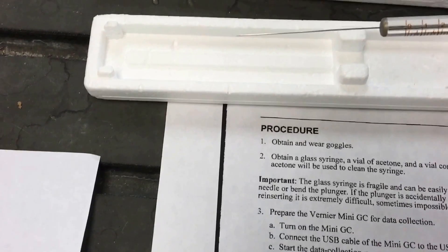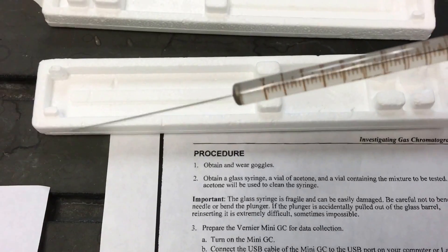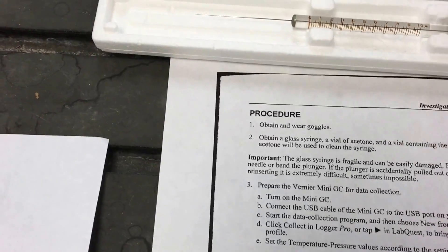It's a pretty precise amount to inject. The maximum you can see on top is 10 microliters, and you can draw as little as even one microliter.